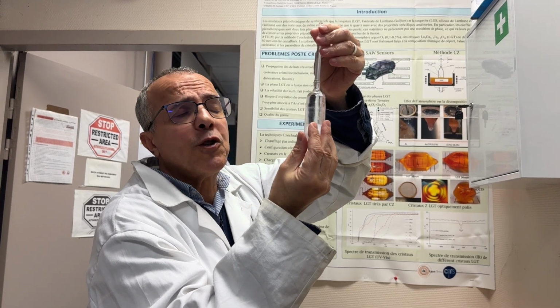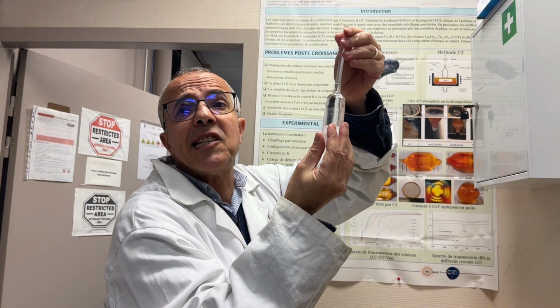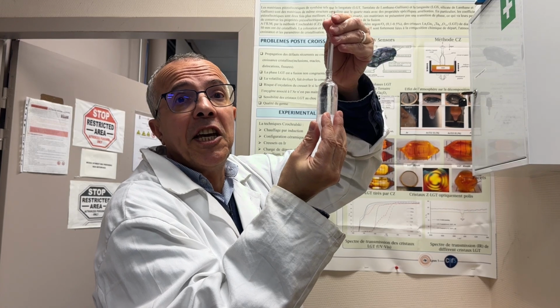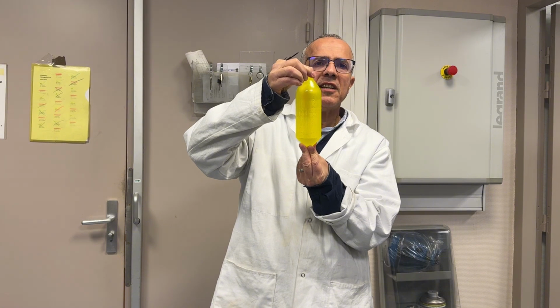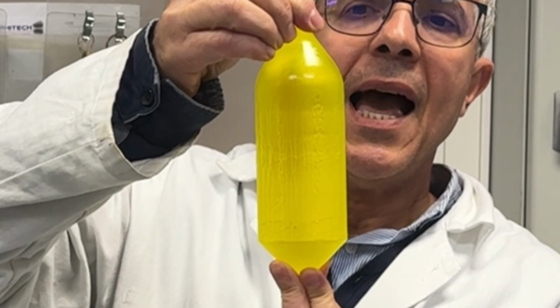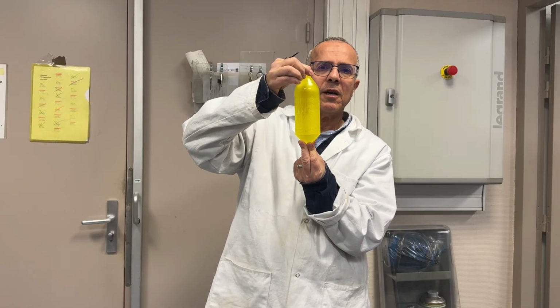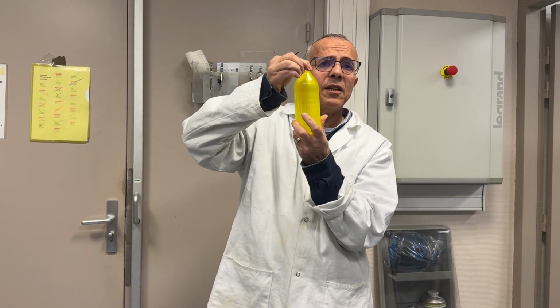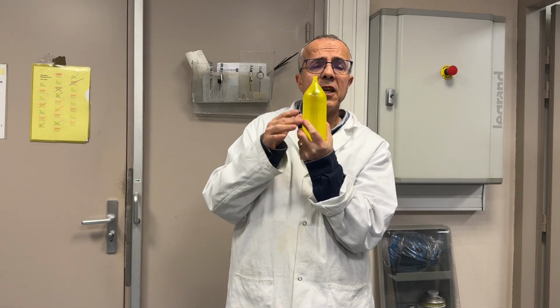But I will show you some other crystals that we grow by the Czochralski technique, especially scintillating crystals that we are using for the TWISMA project, and especially GAGG crystal. That is a GAGG scintillating crystal. As you see, the color is yellow. It is because of cerium emission, and this crystal is a good scintillating material. It is used for high energy physics applications, and this crystal is grown from the melt using an iridium crucible, and I showed you an example of an iridium crucible before.